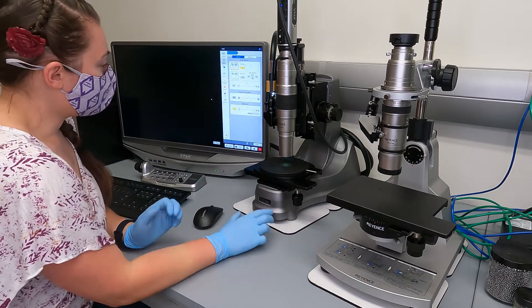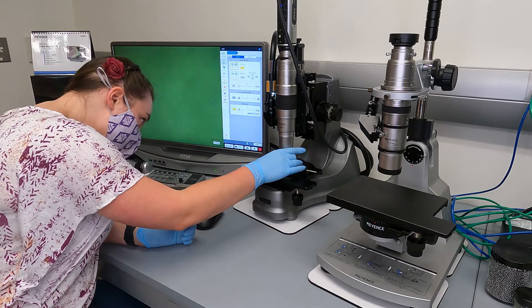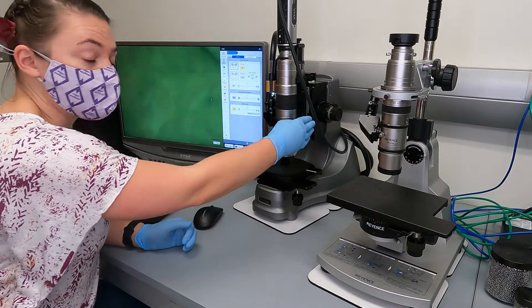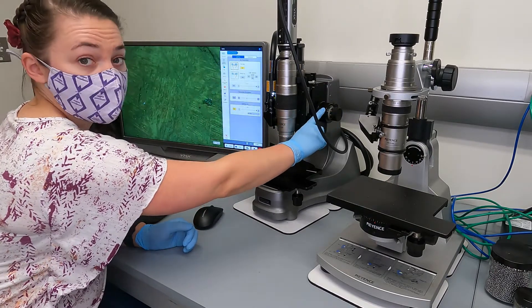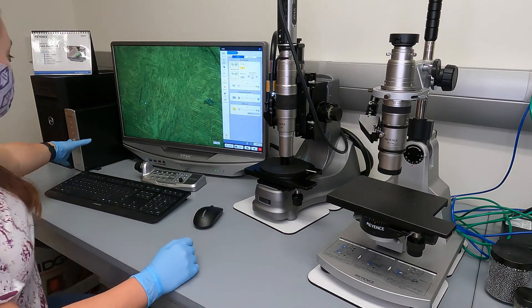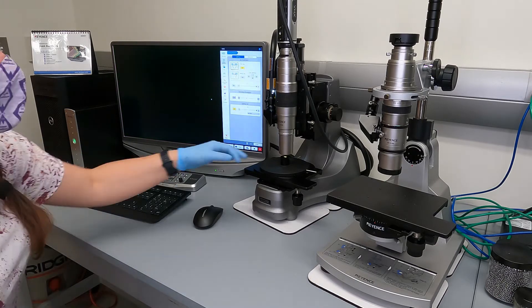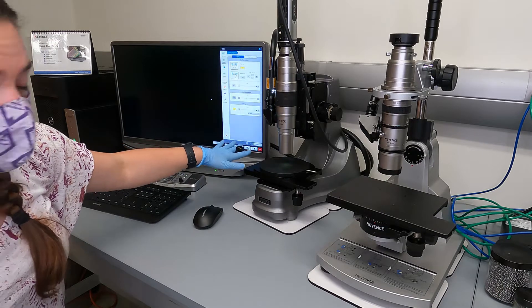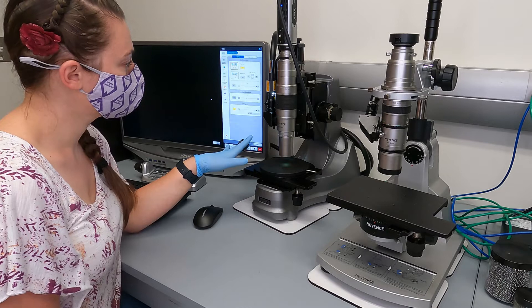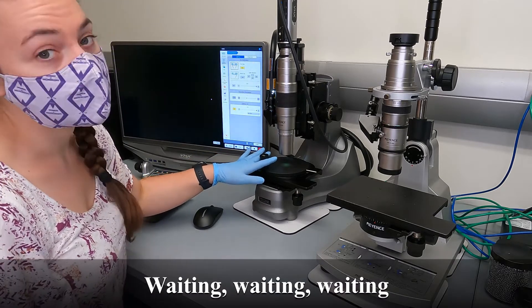When you turn the lighting on, you can then put your sample under the lens. You could focus manually using the coarse focus and fine focus, or you can turn on the measurement unit control, which turns on the motors. Make sure you remove your sample while it's initializing so that it doesn't get hit. It initializes twice, so be patient.